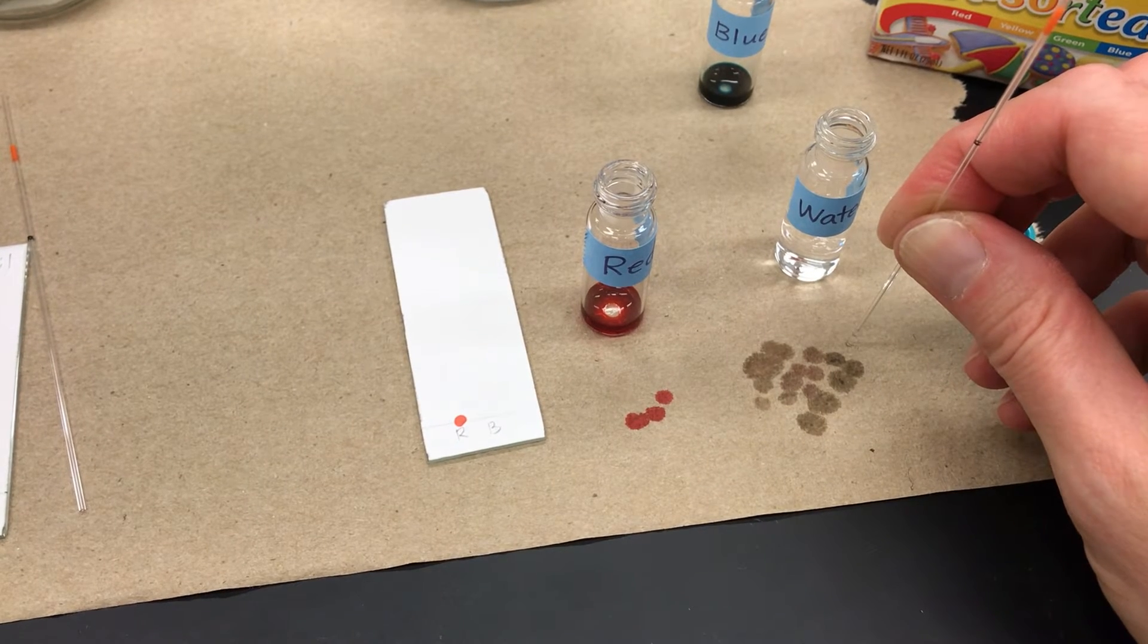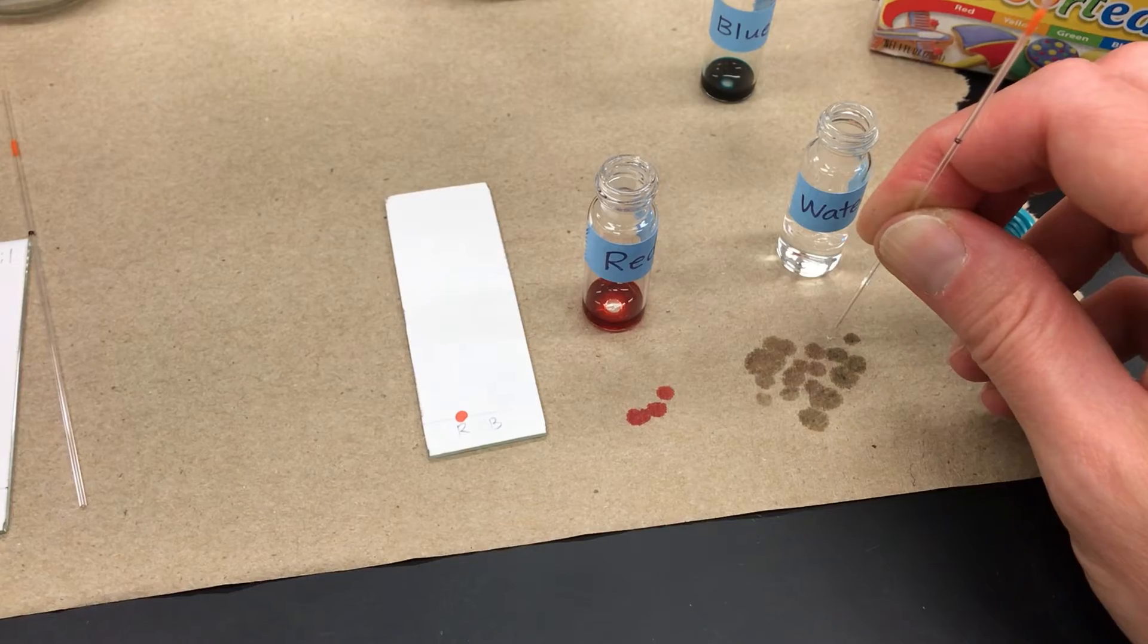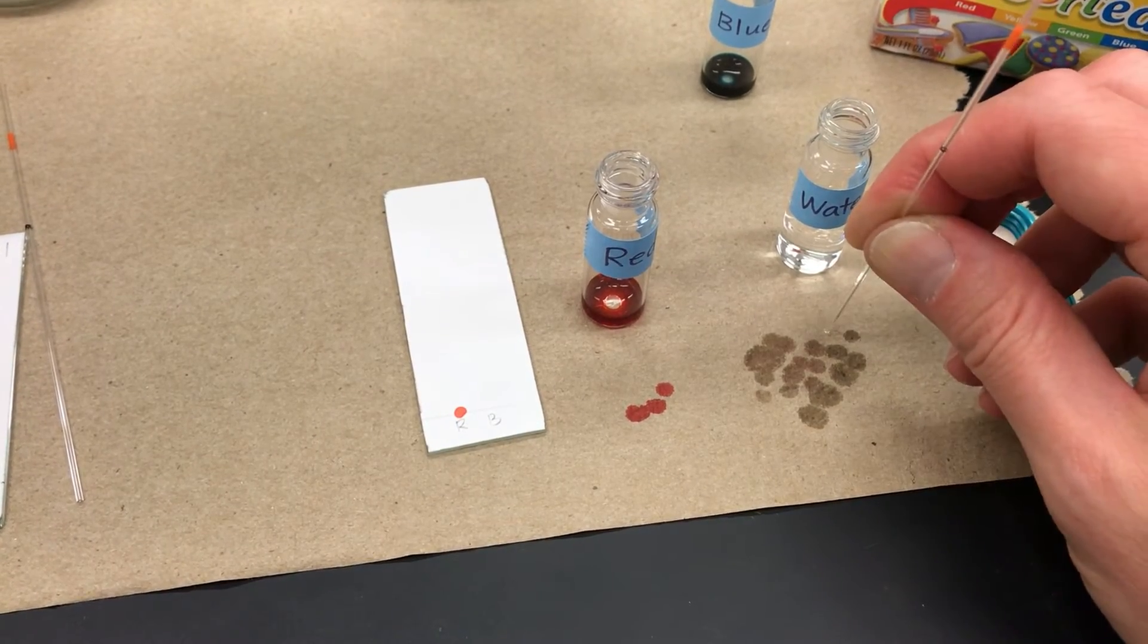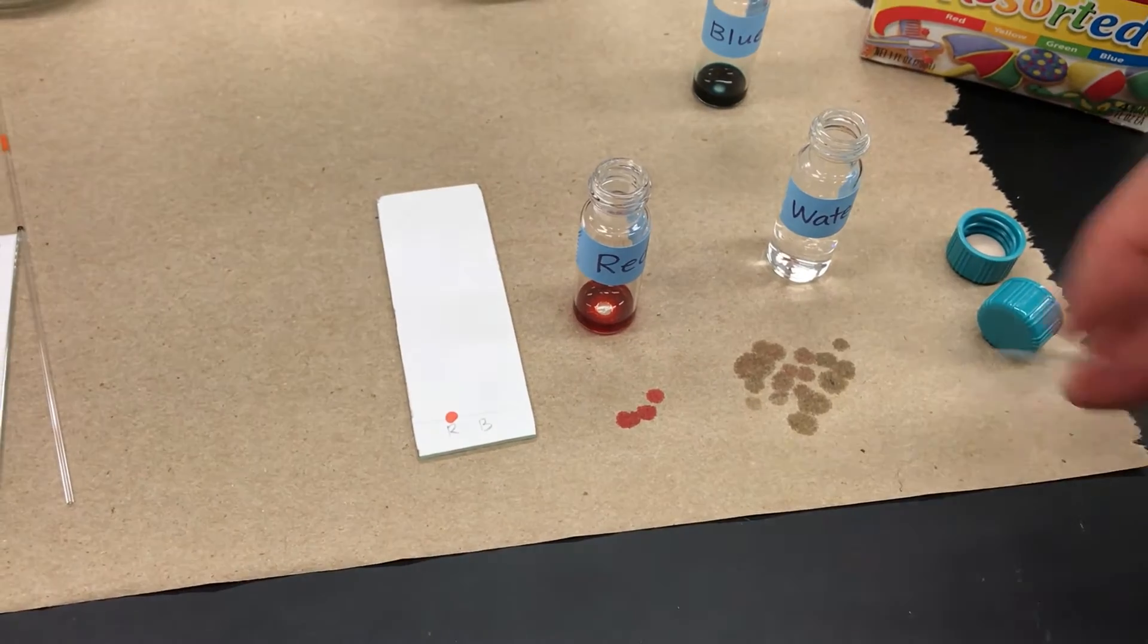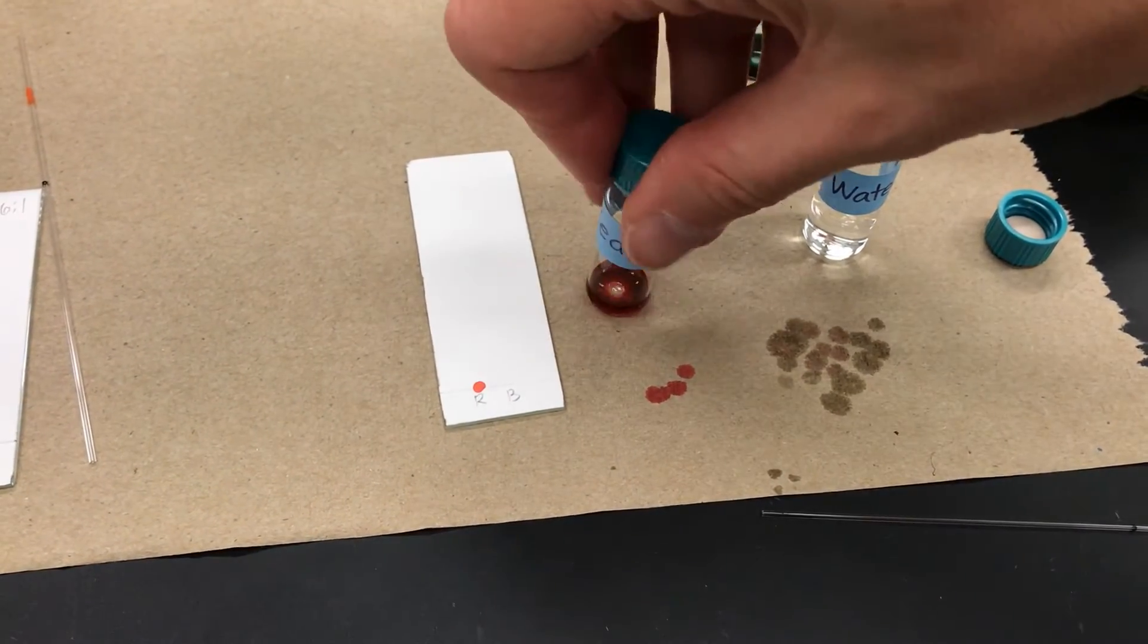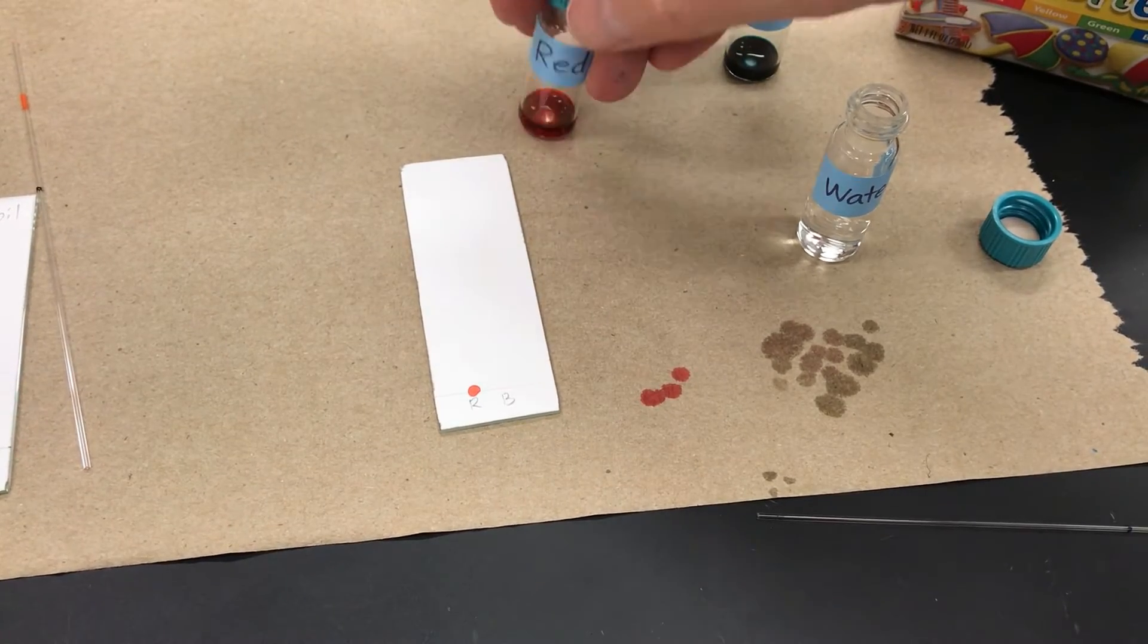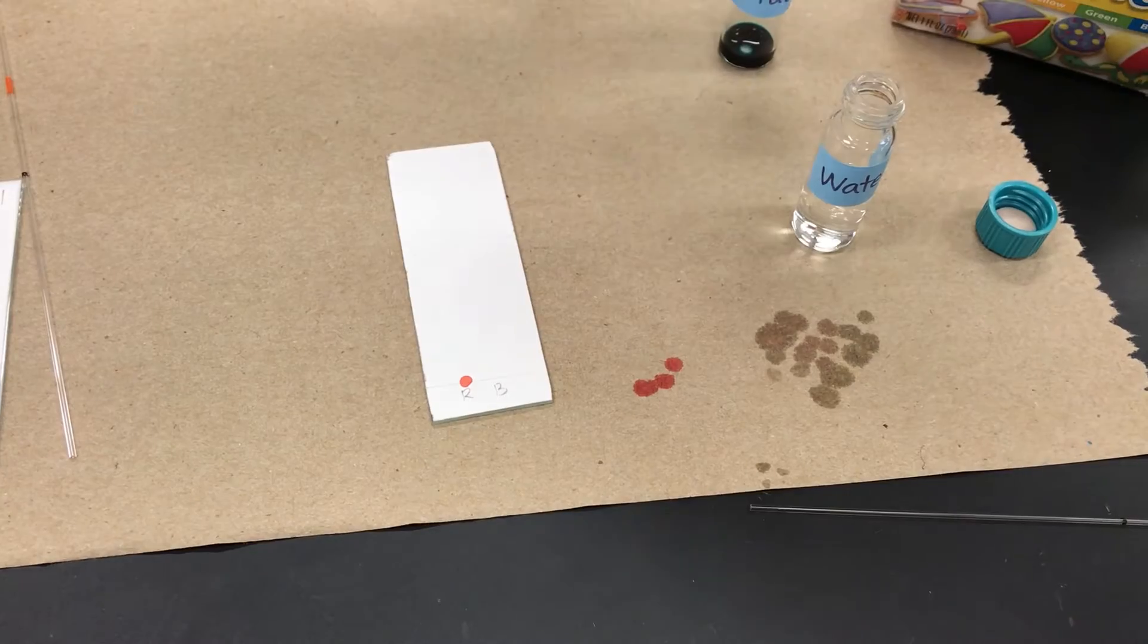Here I decided to rinse it twice just because it looked like there was still some red color to the tube. And then I decided I didn't like having these vials open because that's a spill hazard. So I'm trying to close it with one hand, which is tricky.